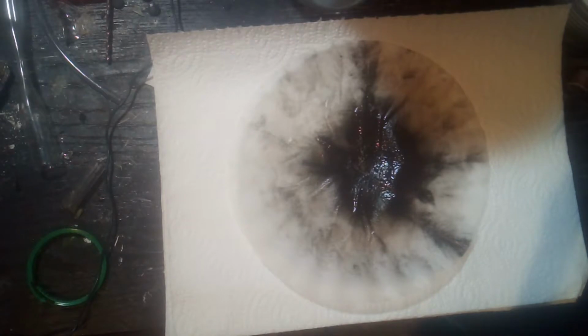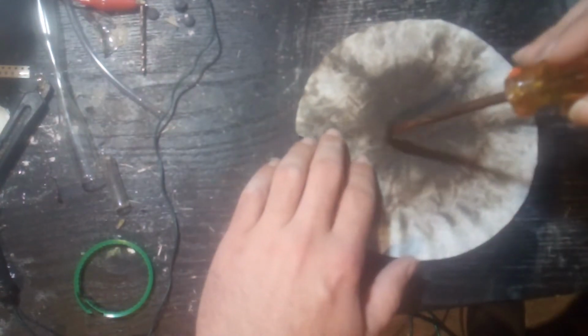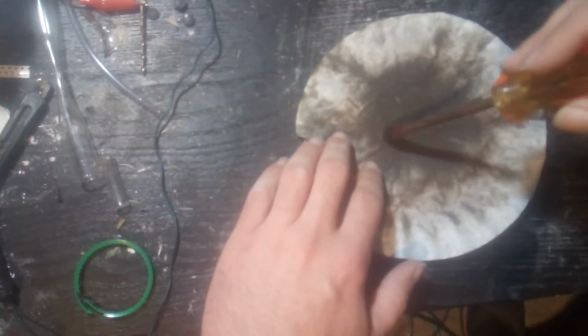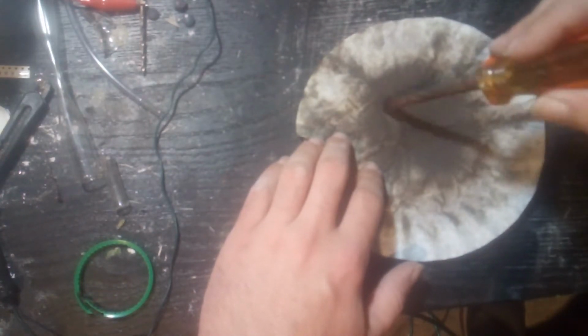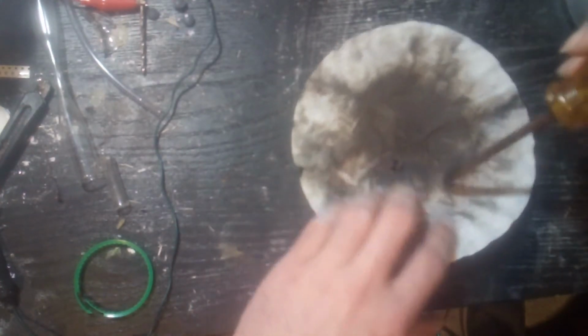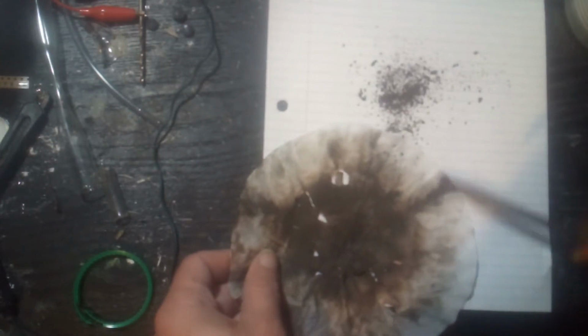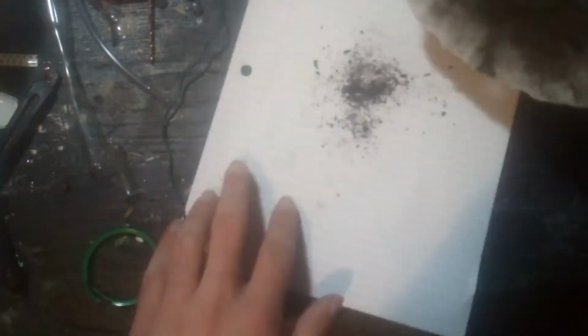And, well, I might even hit that with the heat gun to dry it out a little faster. I'll be back. And there it is, all dried out. What would have taken hours took minutes. And I scorched the filter a little bit in the process. And the filter's become a bit brittle. Okay, a lot brittle. Okay, you stay. You go. That's probably the best I'm gonna do.